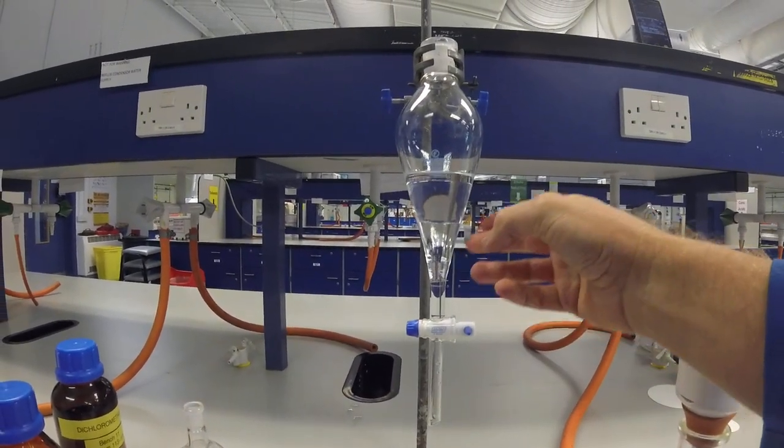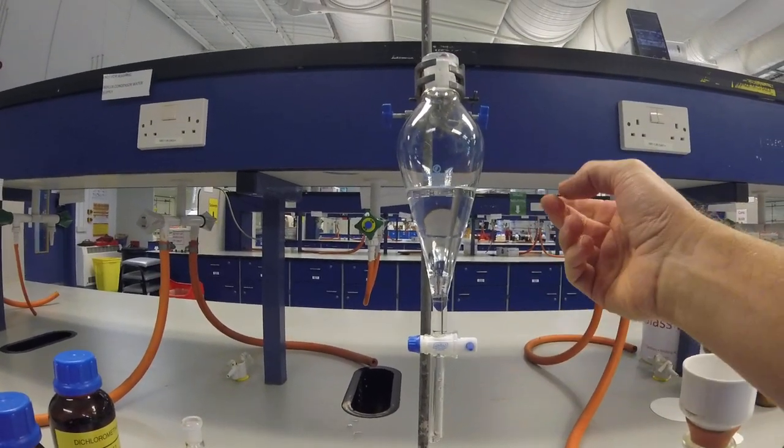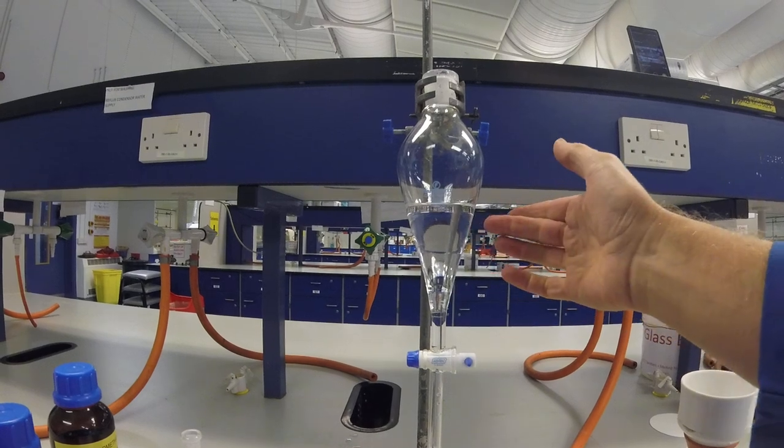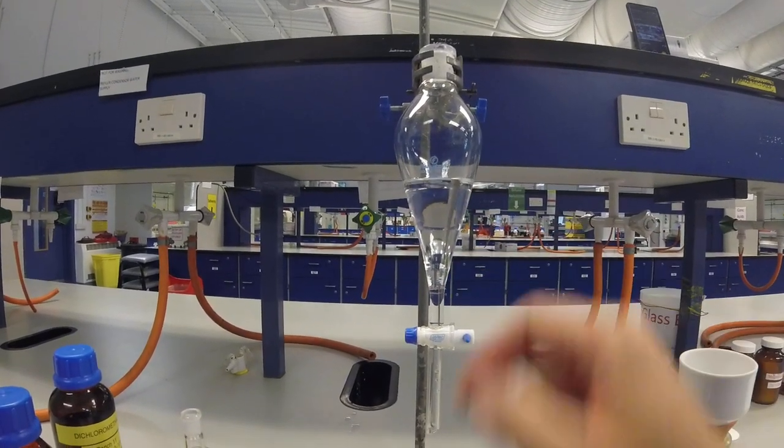The majority of organic solvents will be less dense than water, so it will be on the top and then you've got water on the bottom.